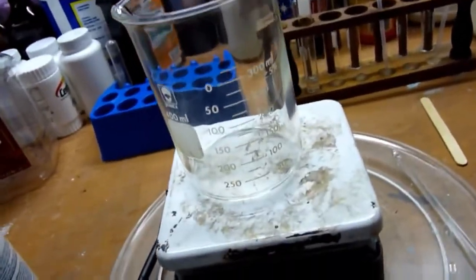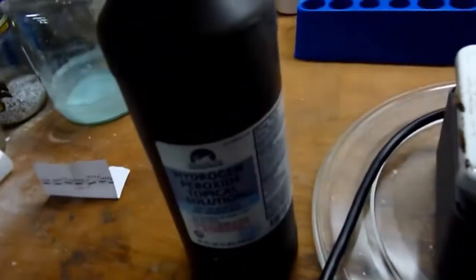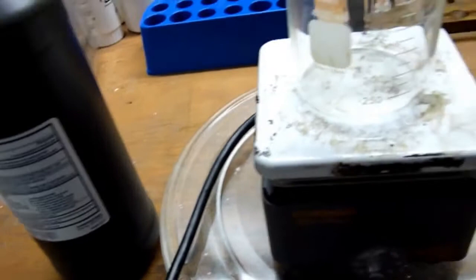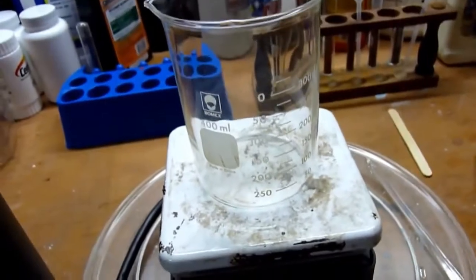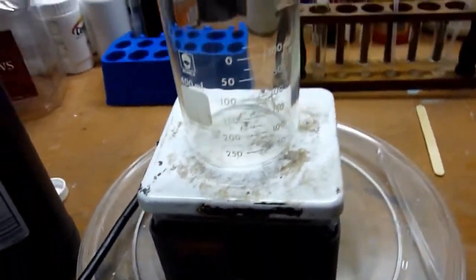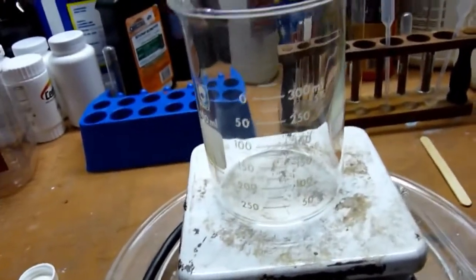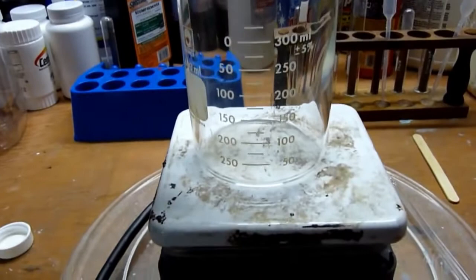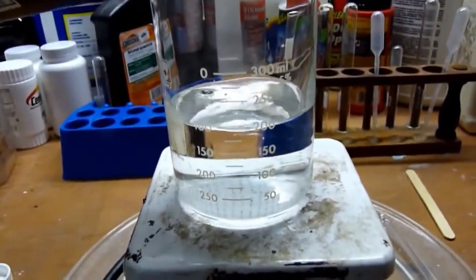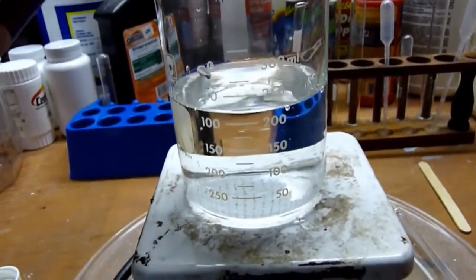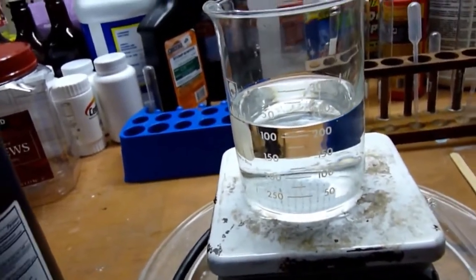My synthesis calls for 235 milliliters of 3% hydrogen peroxide, and I'm concentrating it to 30% or thereabouts. So, I need to essentially simmer this down, or simmer 235 milliliters to 23.5 milliliters. Honestly, you can just guesstimate because it's 200, let's do 250. That'll account for the decomposition, or a lot of it anyway.